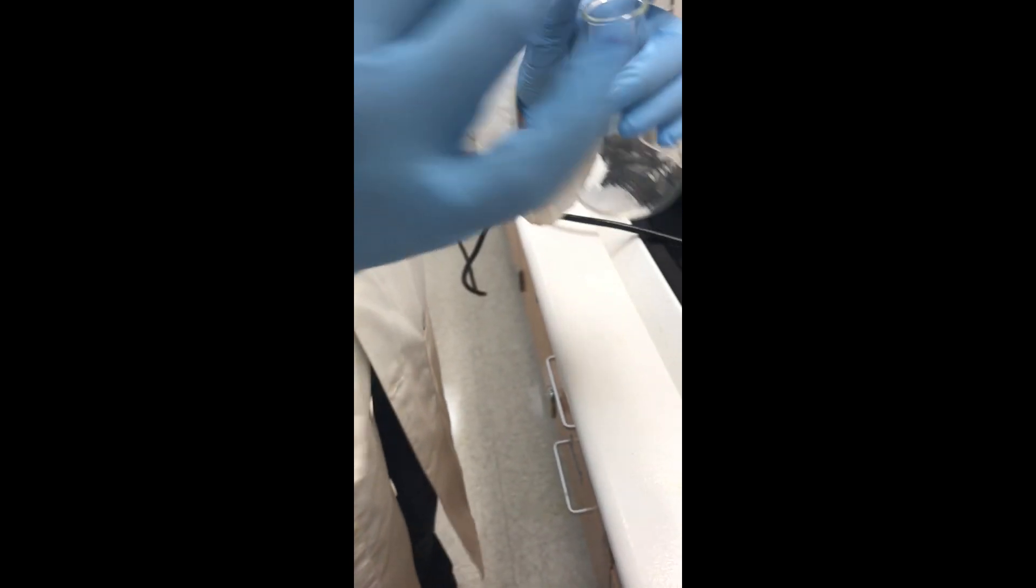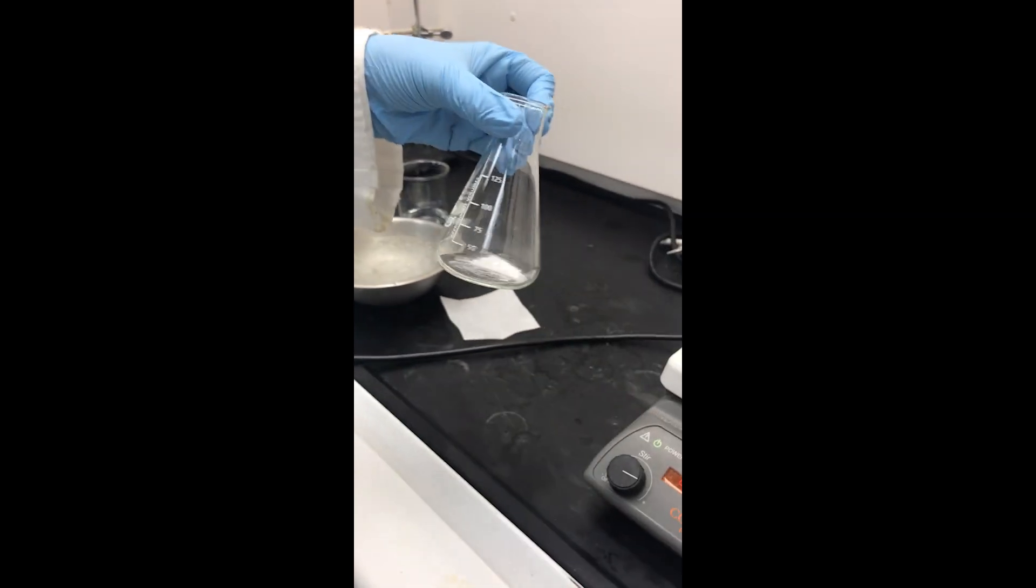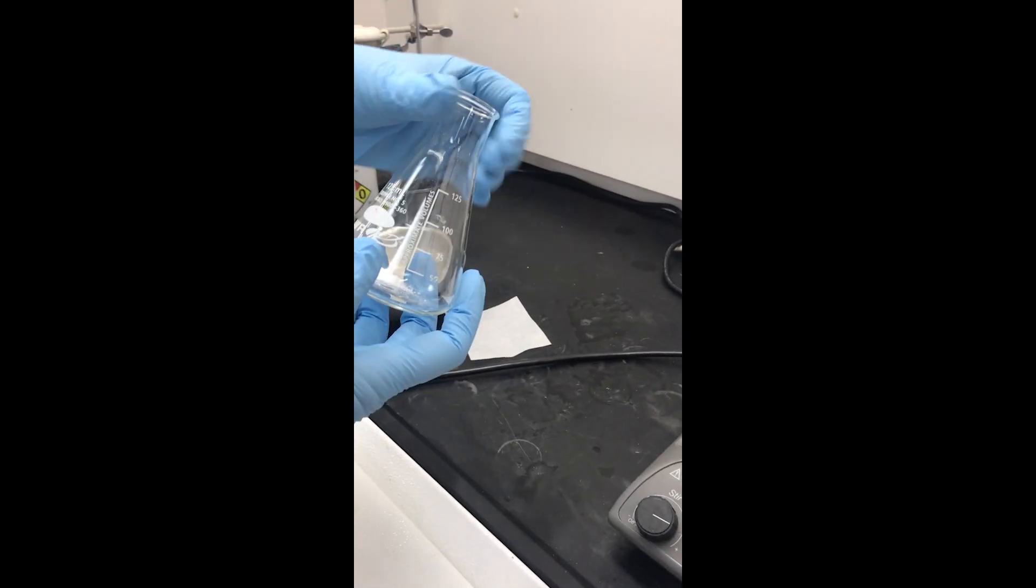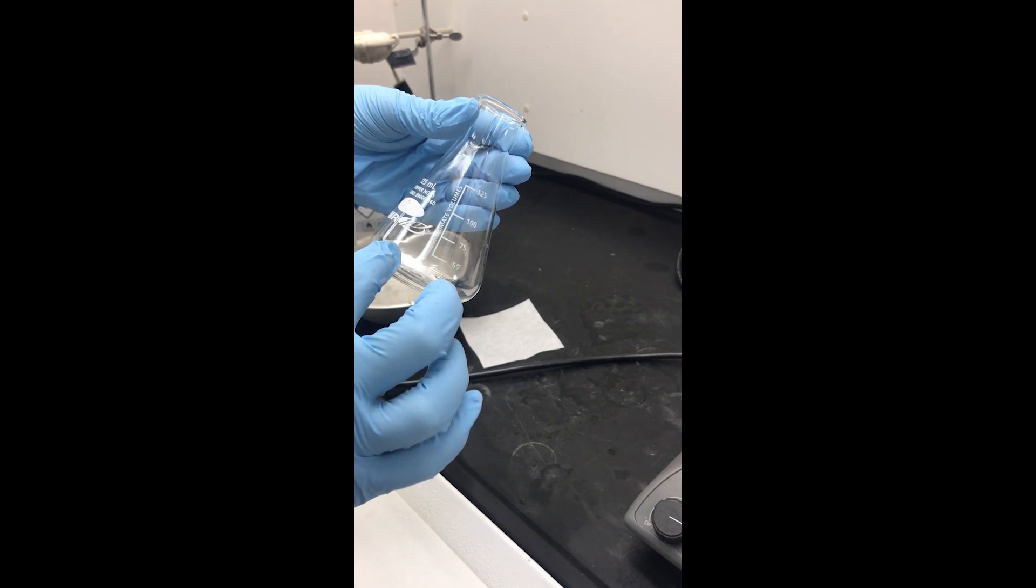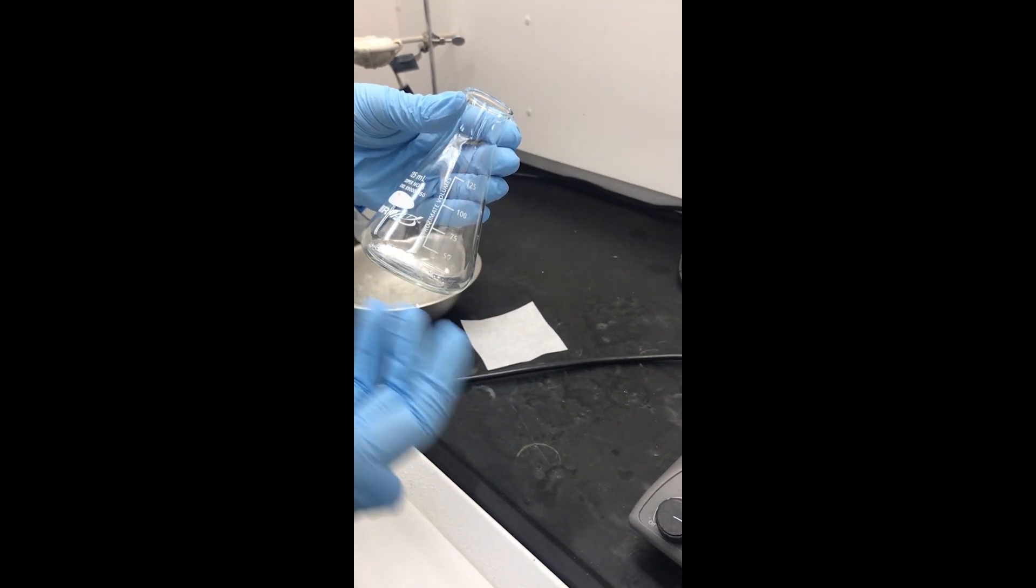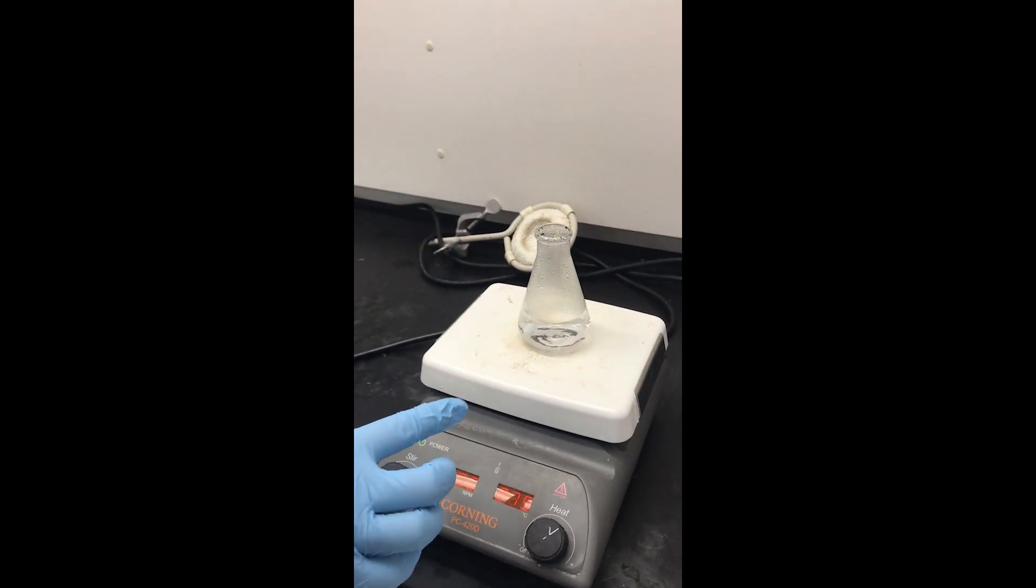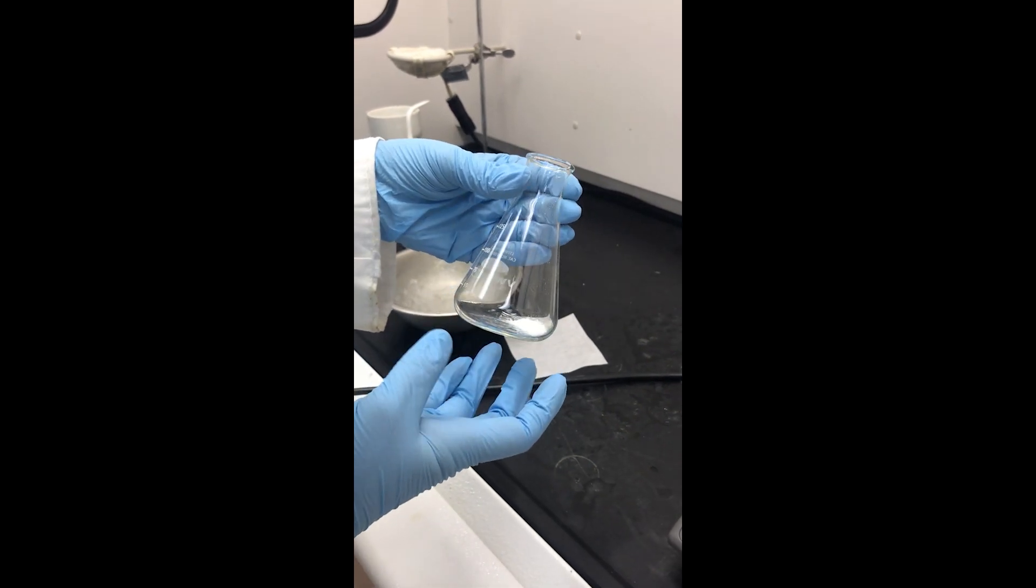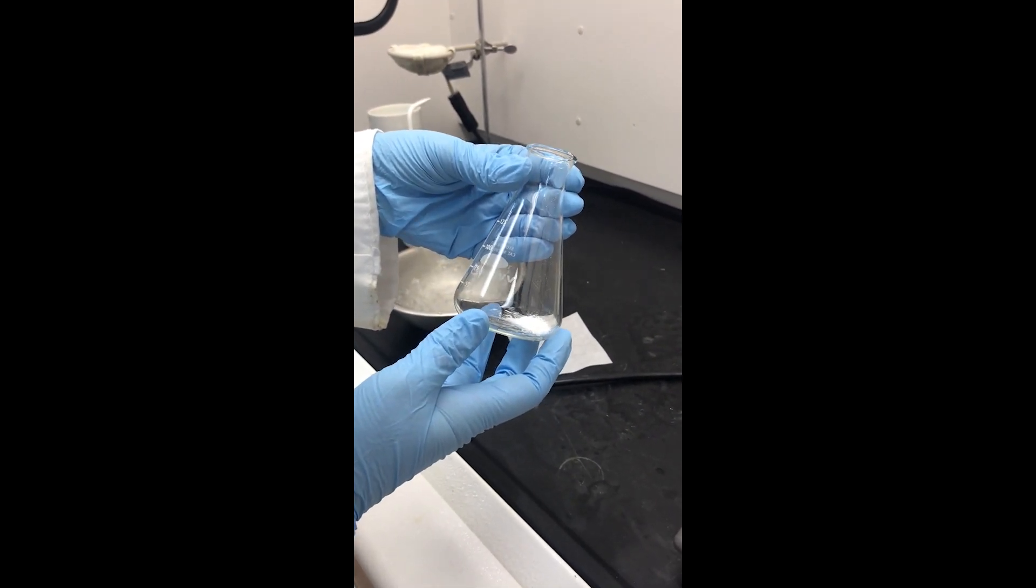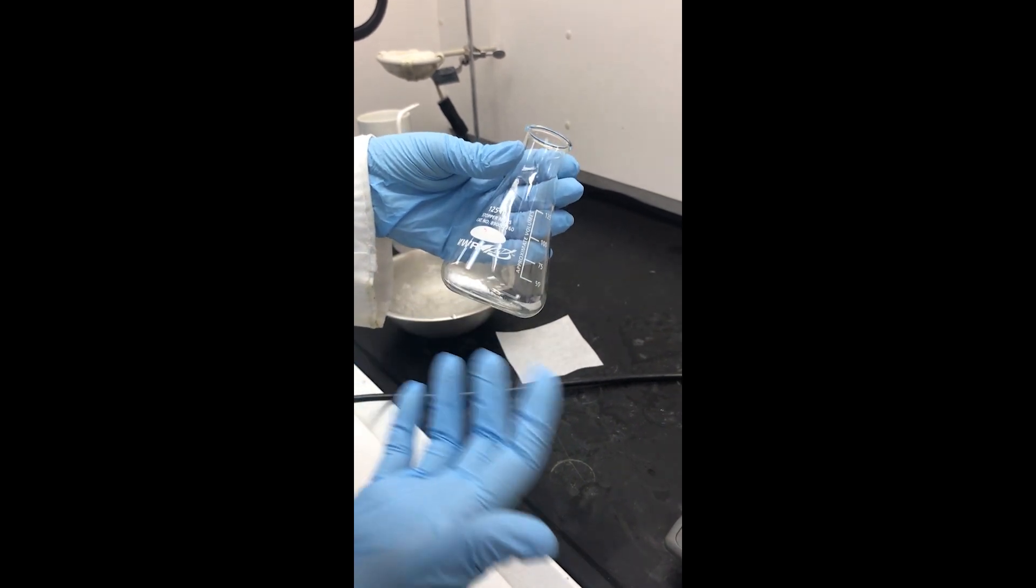Just carefully pour it, give it a little shake. I'm gonna be adding the solvent to the solid until all of the solid is dissolved. I have some boiling water on a hot plate and I'm going to be adding that.